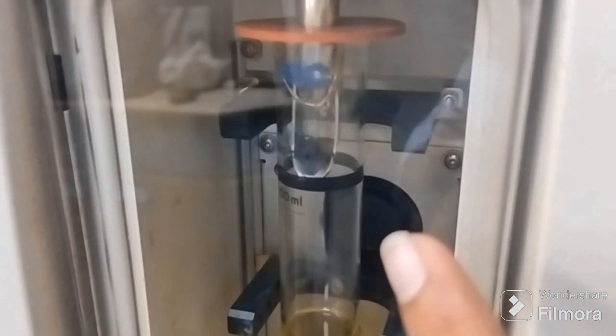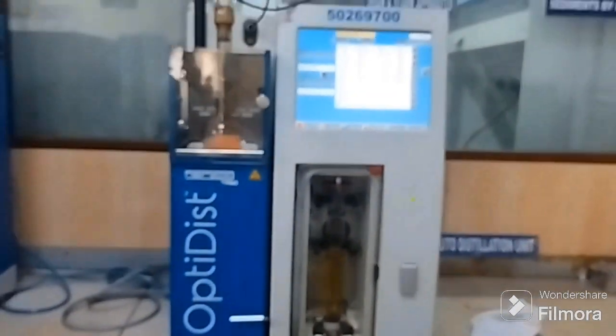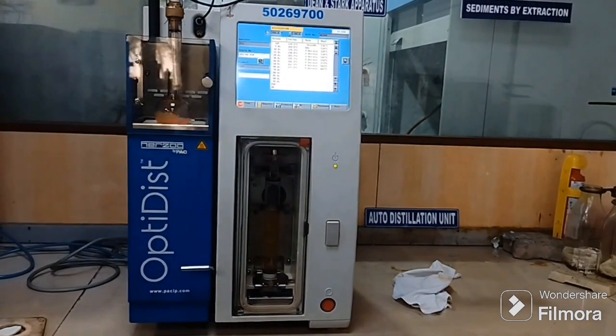And at the upper edge you can see that black clip kind of thing, so that's the first droplet sensor, right? When the first droplet of that vapor, which was converted into vapor state on heating, is regained back on cooling into drop form, right?